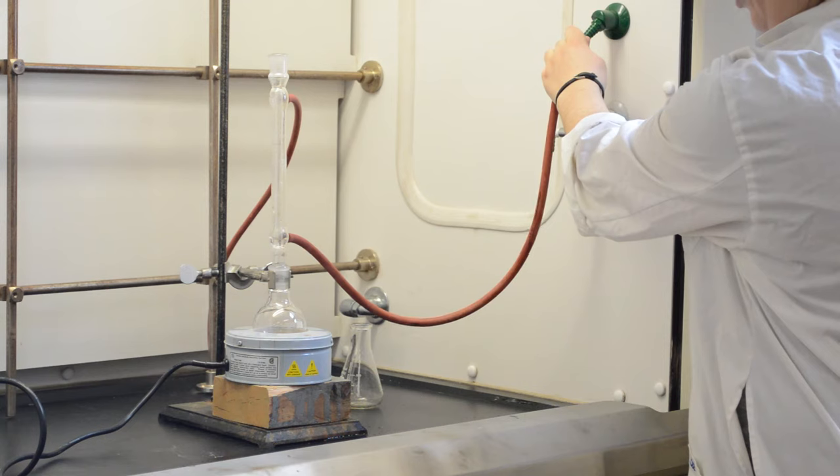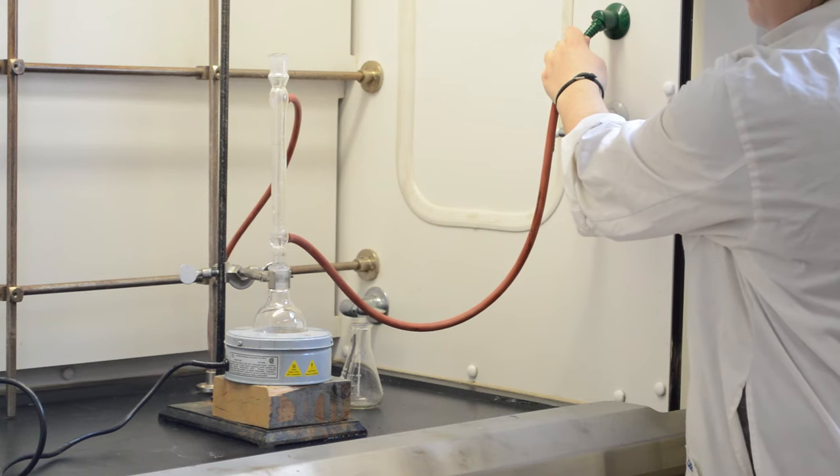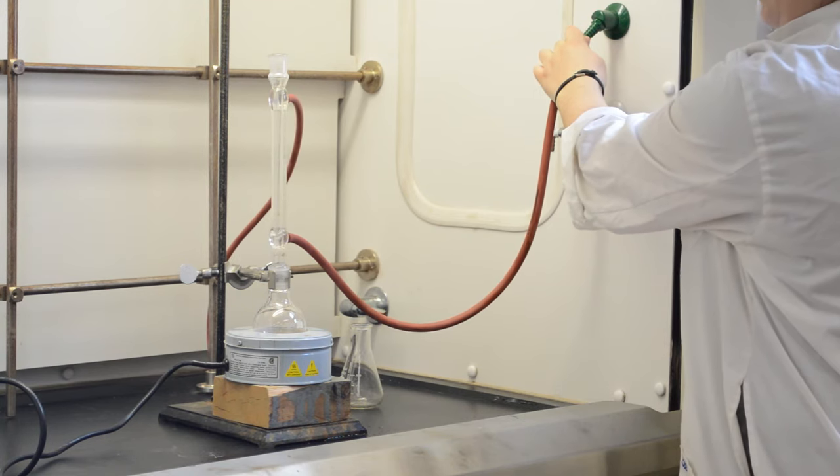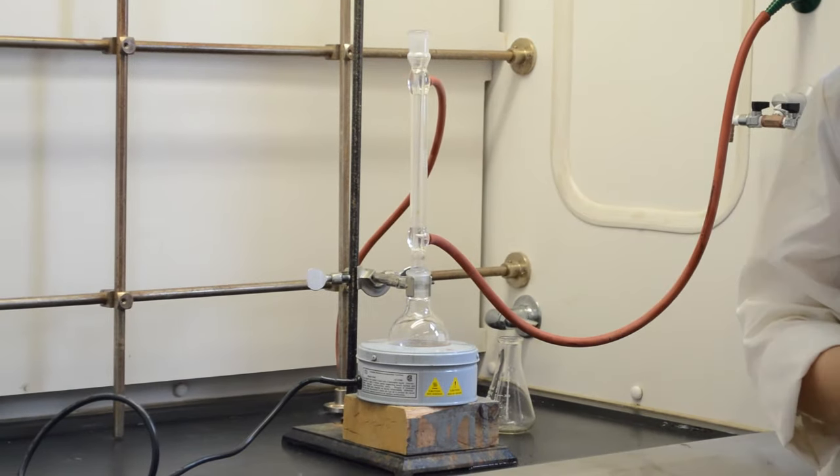Very carefully turn on the cold water, making sure that it's draining into the sink, and then you can begin heating.